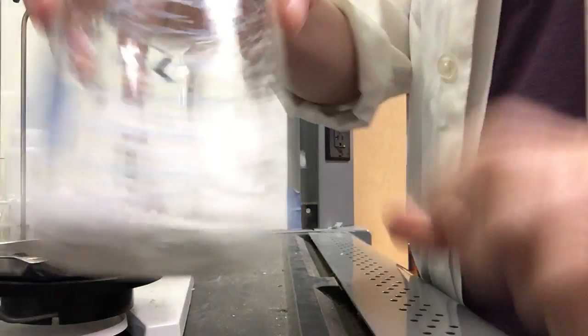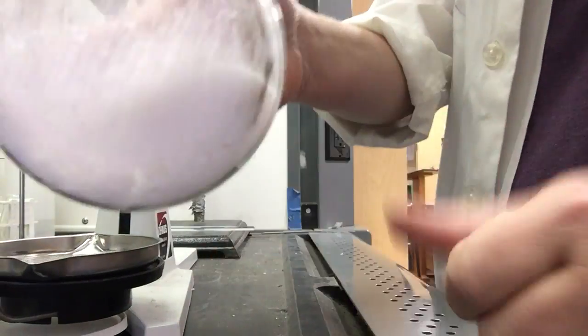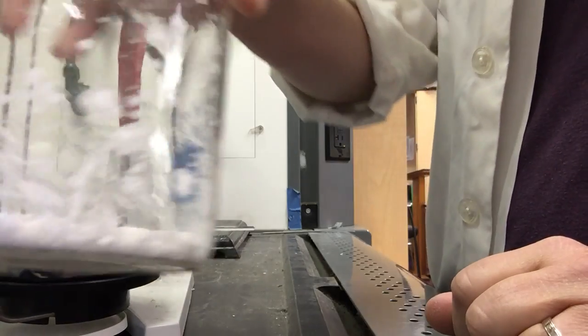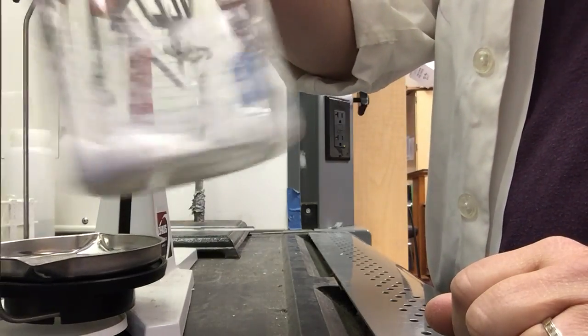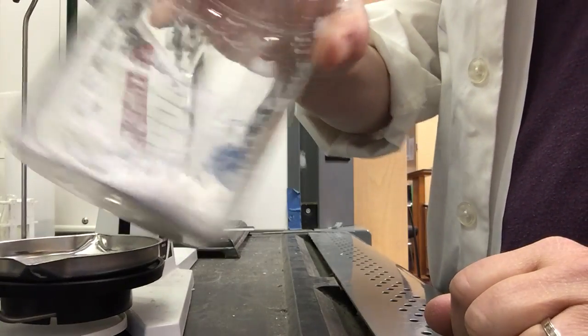Okay, so we're back and this has dried overnight. This is the salt that was recovered from my filtrate and you can hear how dry it is when I shake that.